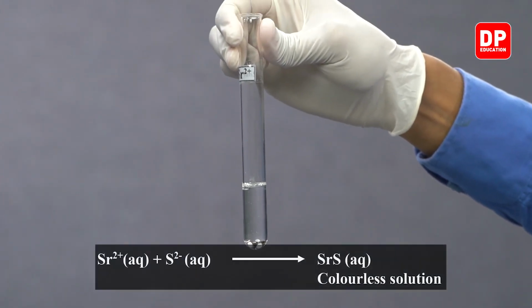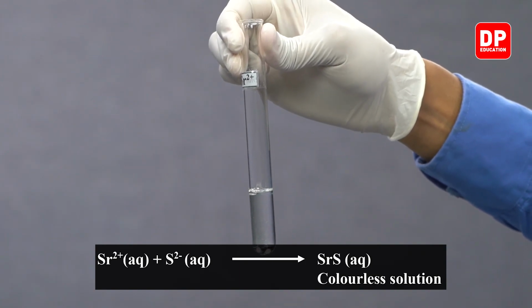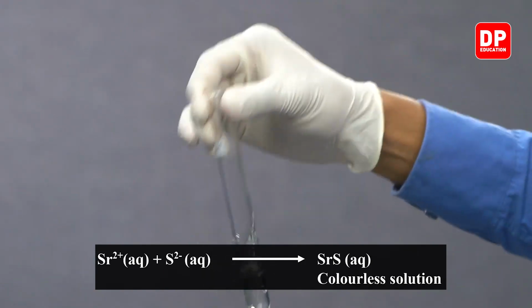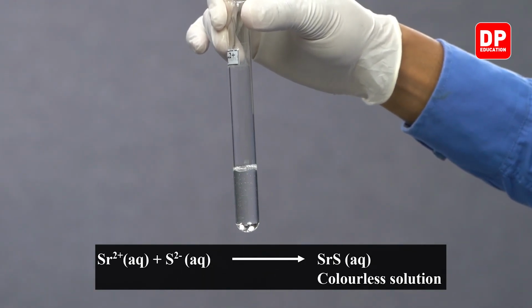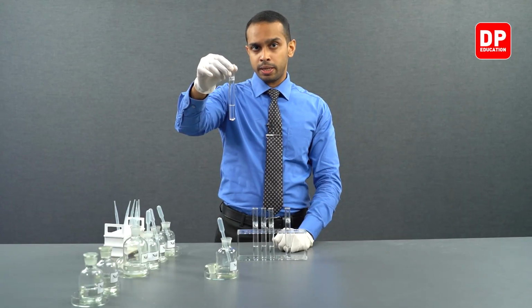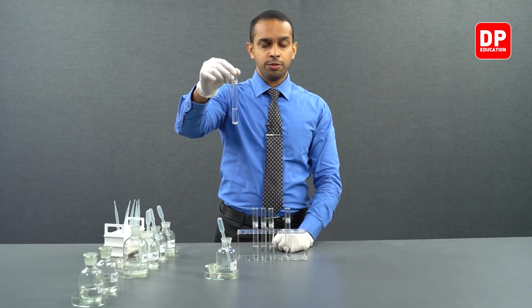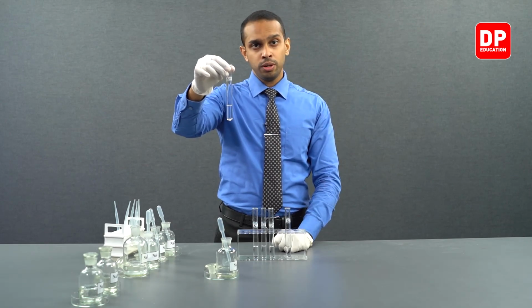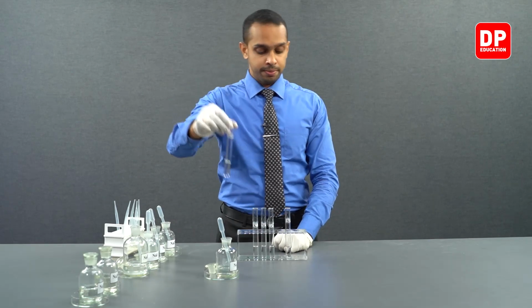When you add sodium sulfide, we did not see a precipitate forming. Let's mix it really well. As you can see, even after mixing it well, we do not see a formation of a precipitate. Strontium sulfide that is formed is soluble in water, so therefore no precipitate is observed.